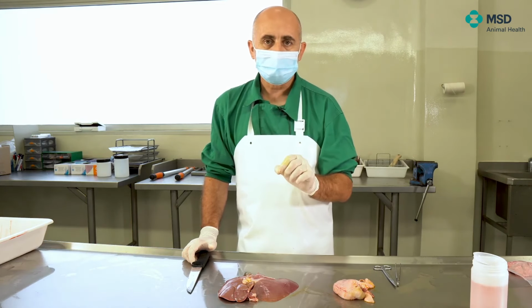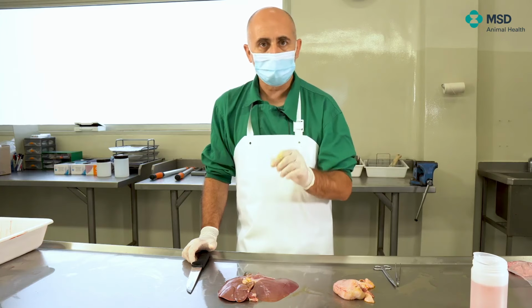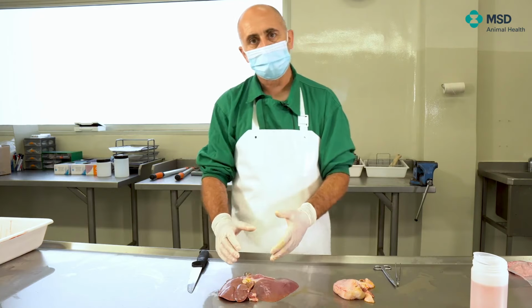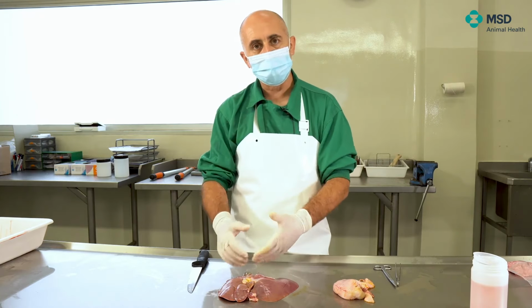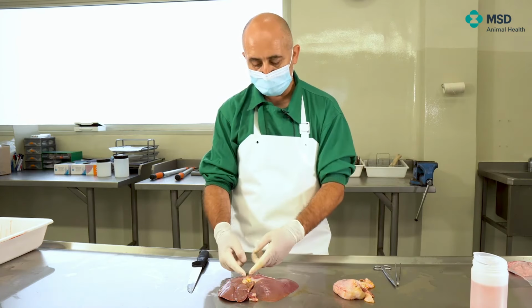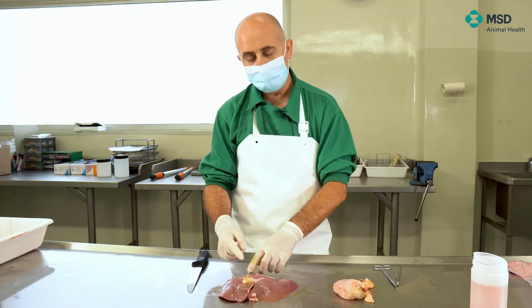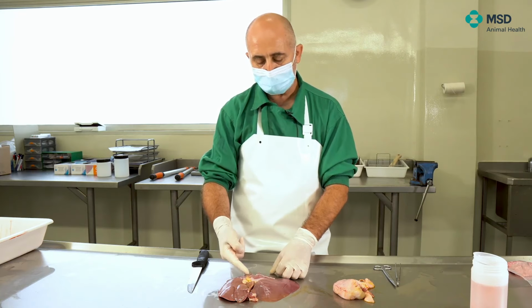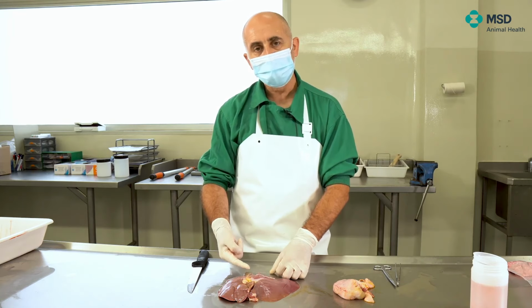The liver cannot undergo edema. In fact, if there's any edema, it must be in the connective tissue which is around different parts. And the part in which there's more connective tissue is around the gallbladder. So from this point of view, what we will do is a longitudinal cut of the gallbladder in order to see if there's edema or not.